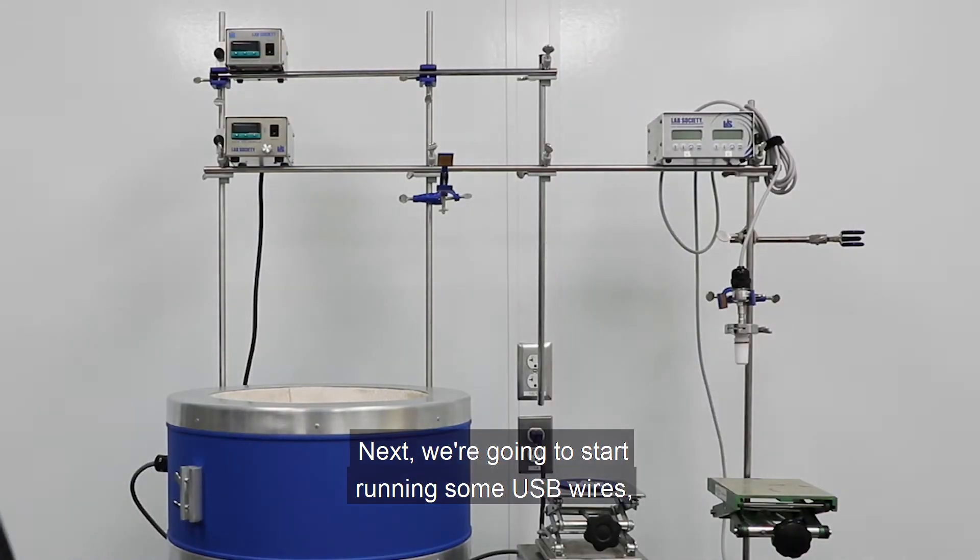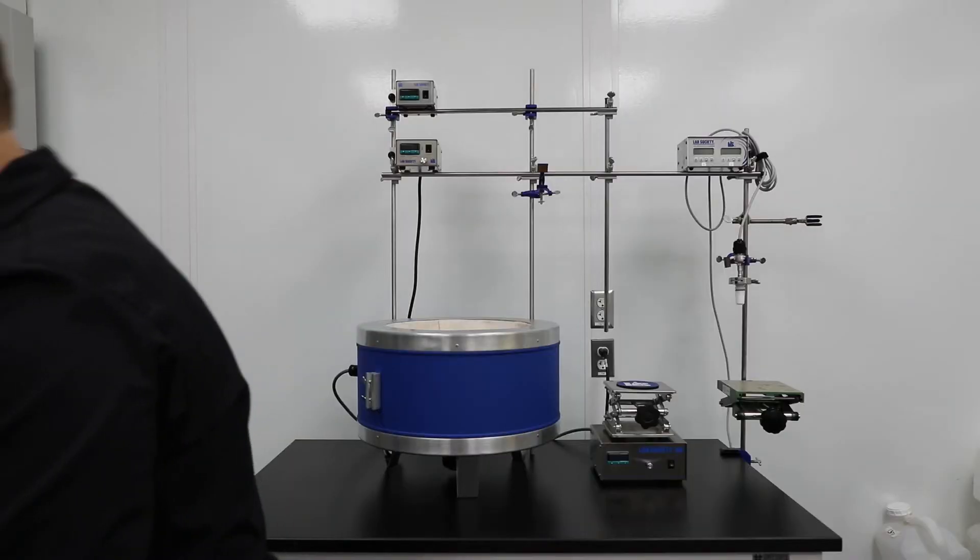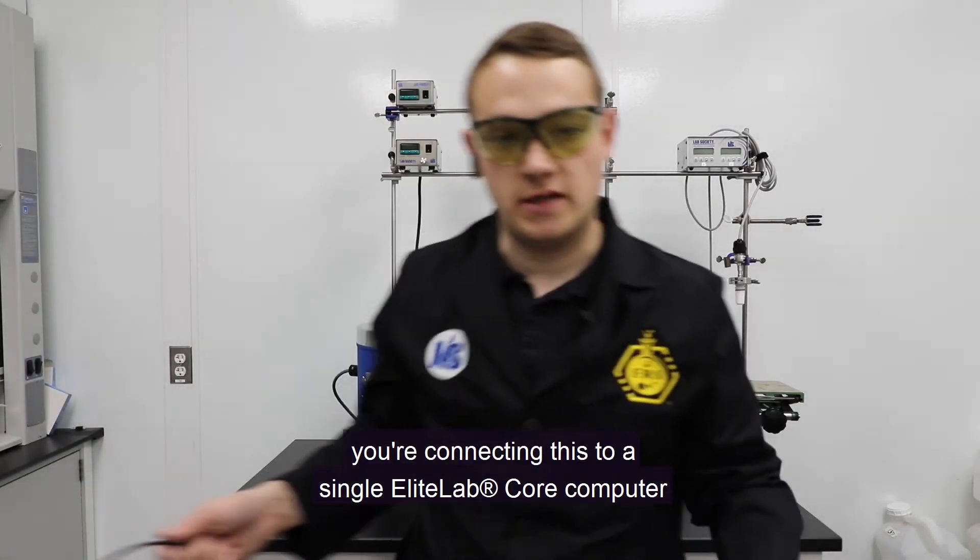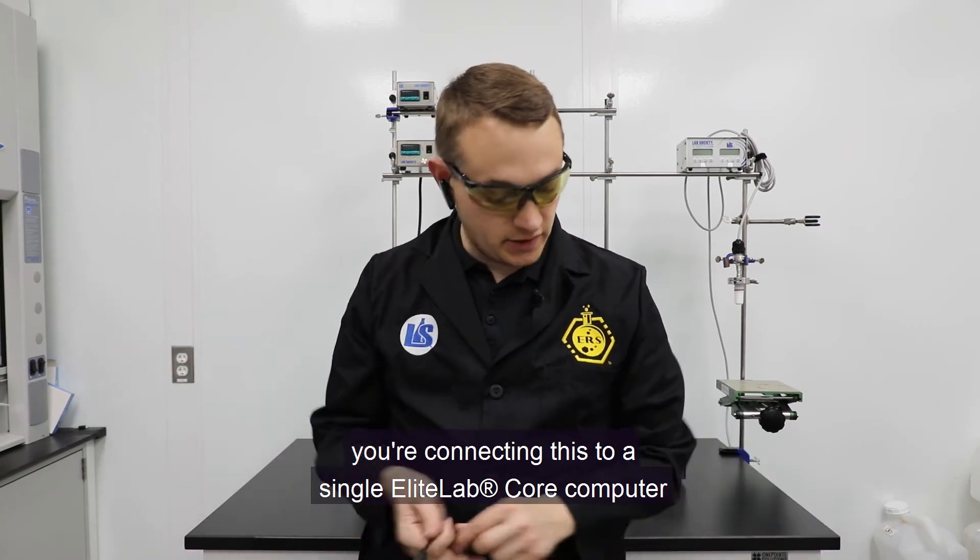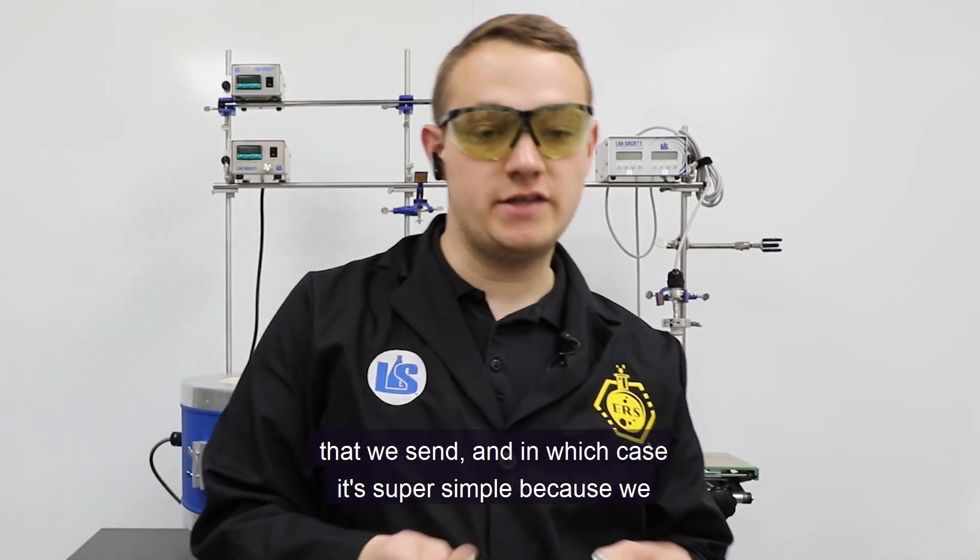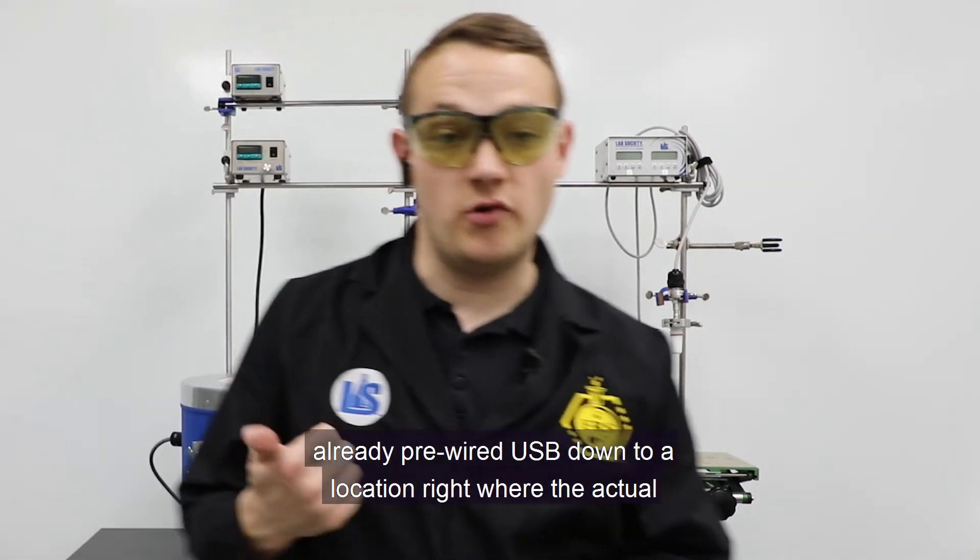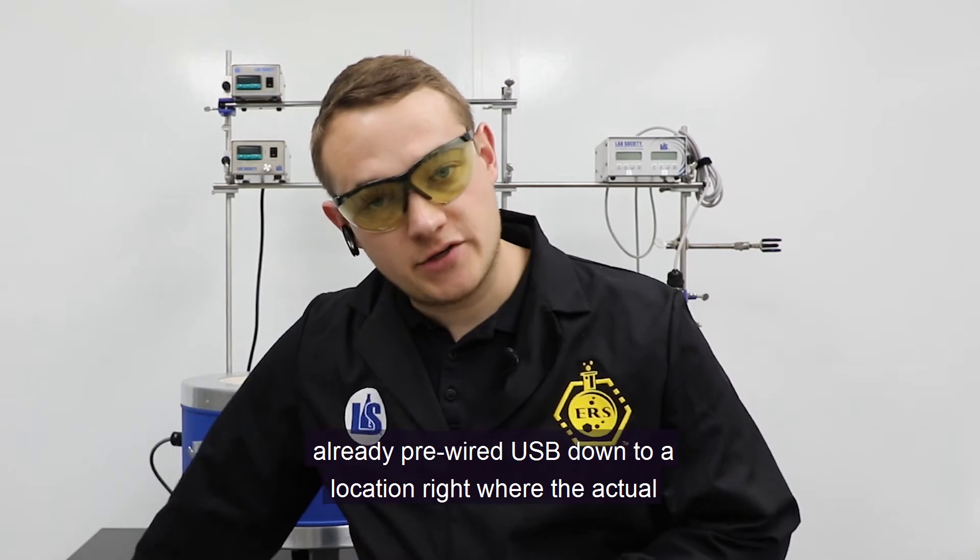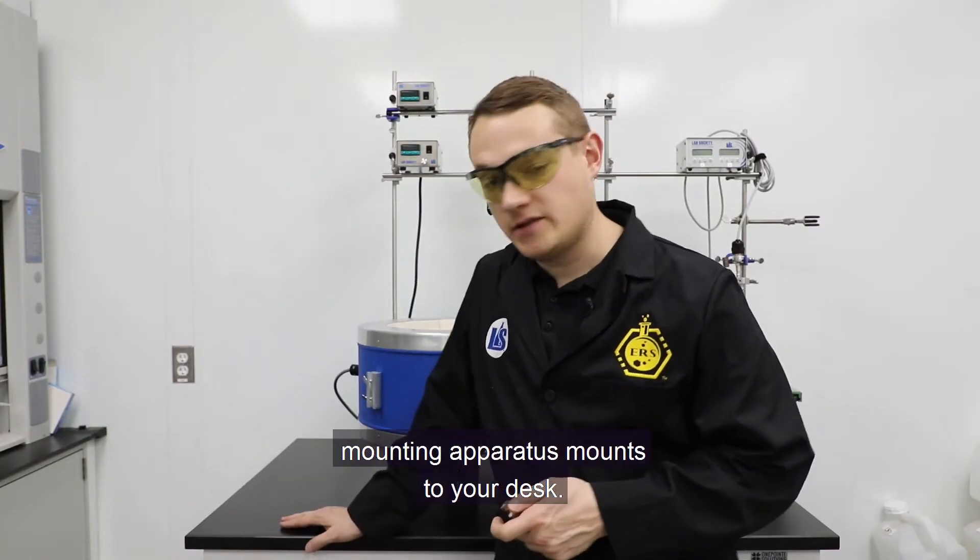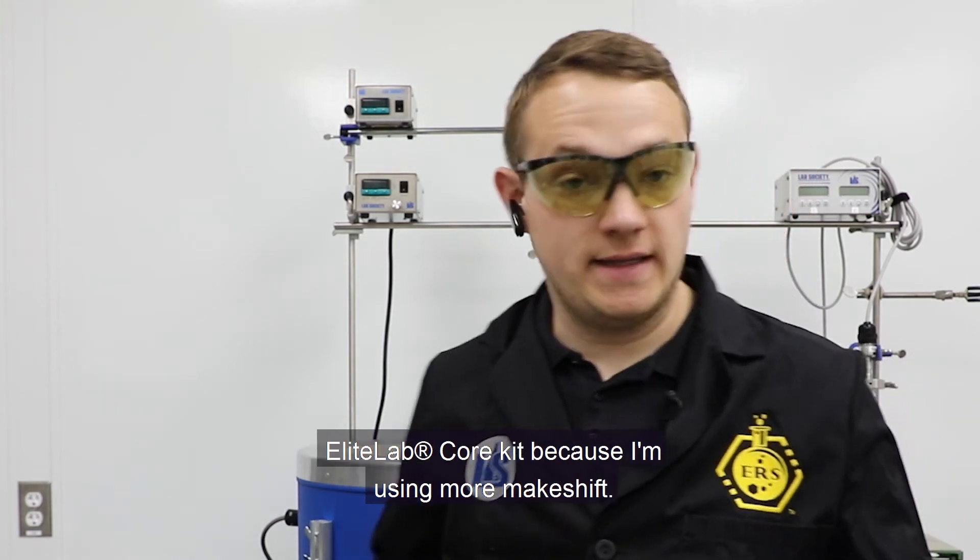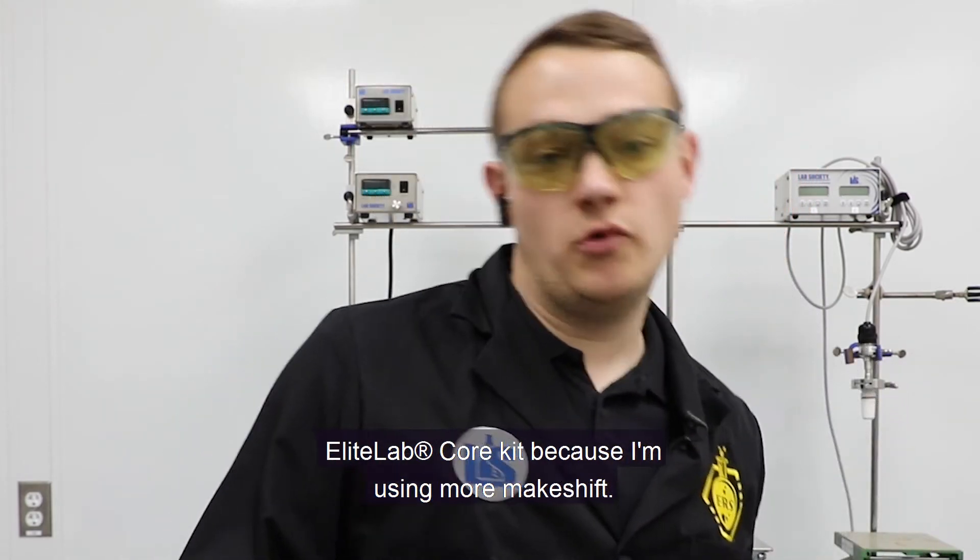Next we're going to start running some USB wires. So running the USBs for this is going to depend if you're connecting this to a single Elite Lab core computer that we send. And in which case, it's super simple because we already pre-wire the USB hub down to the location right where the actual mounting apparatus mounts to your desk. So it's super simple.